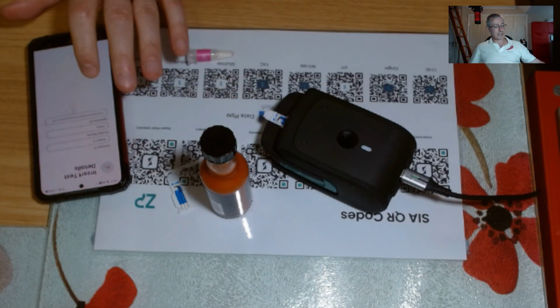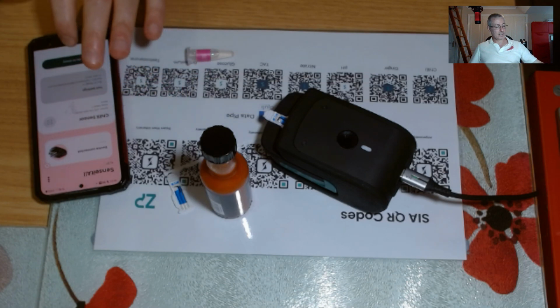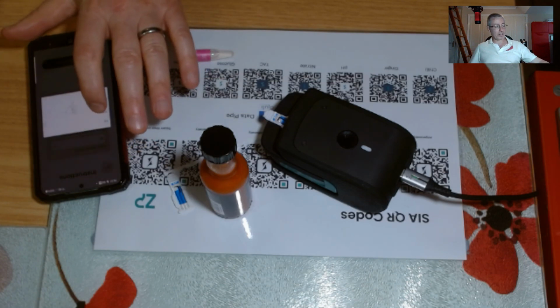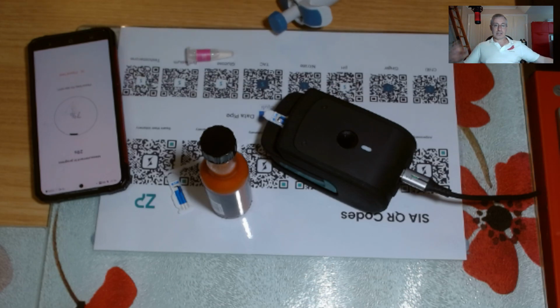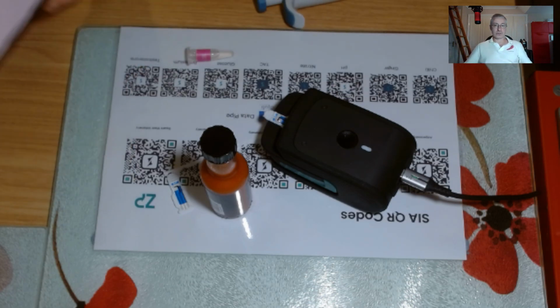I will go to settings, that's fine. I'll go to assay, I'm going to tell it that it's a 1 in 100 dilution, that's done, and then the measurement is off. So that's now progressing away, and I can hold that up here, and you'll see the progression bar.